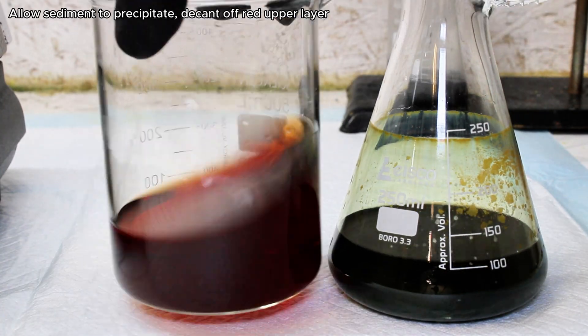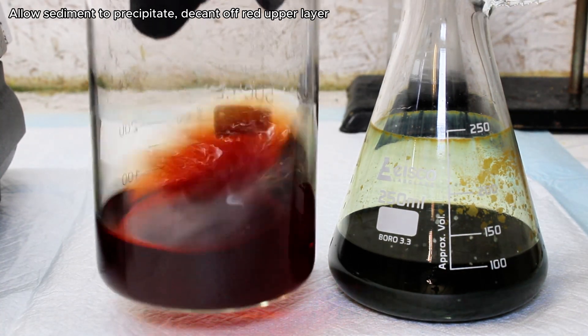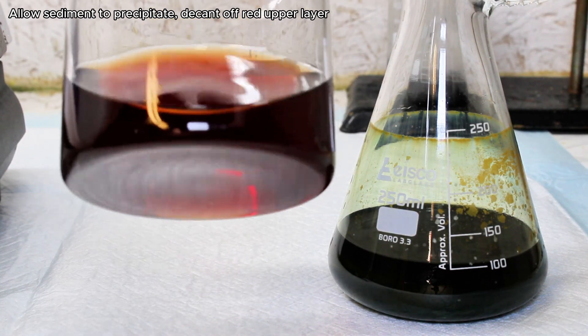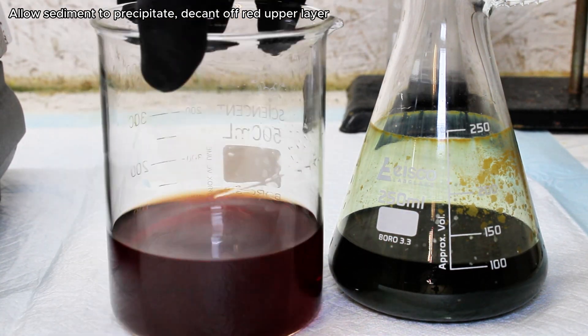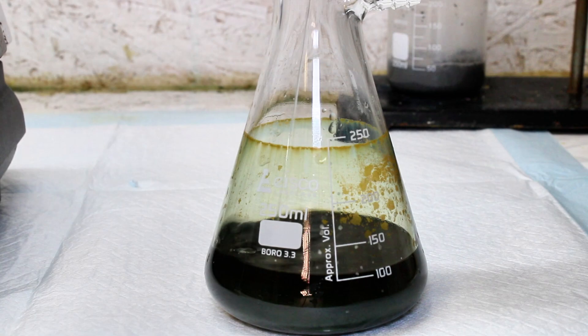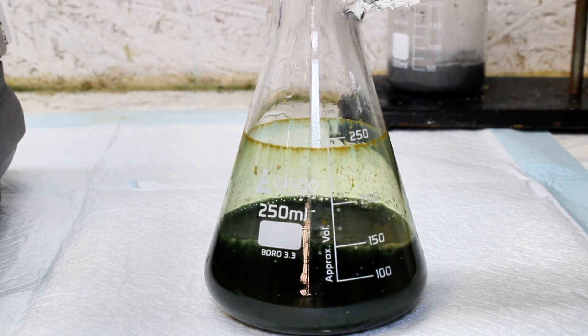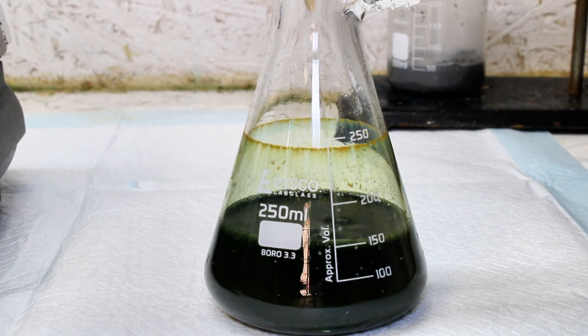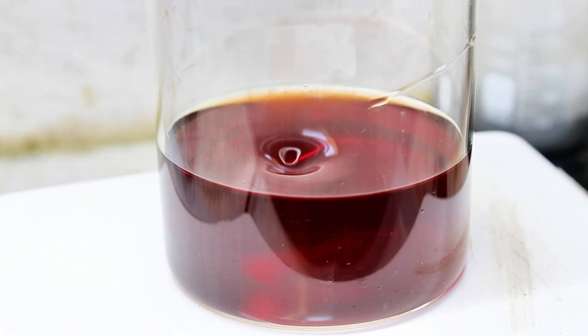And when I came back the next day, I was very happy to see that much of the solid did indeed settle to the bottom, so I went ahead and decanted off my red sodium nitroprusside before adding a bit of water to the crap left behind in the flask to extract what little more I could.